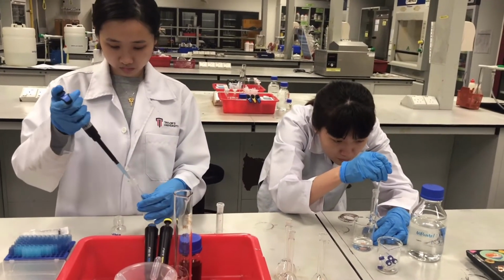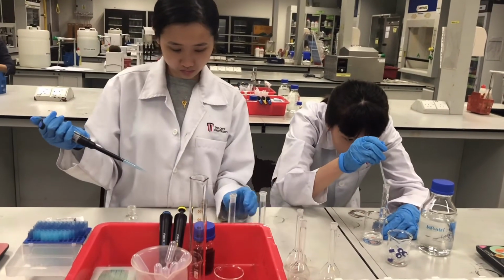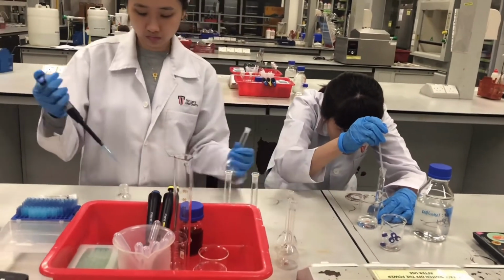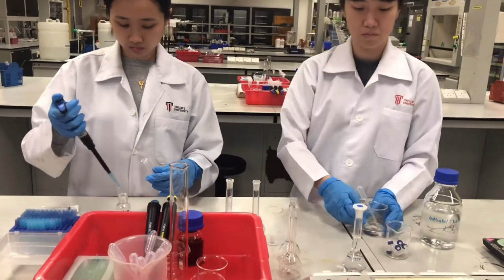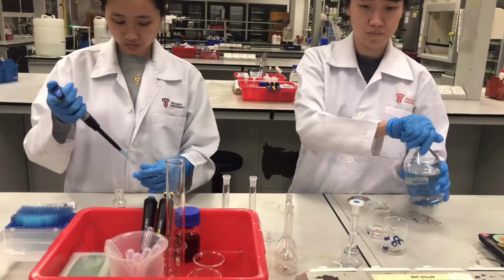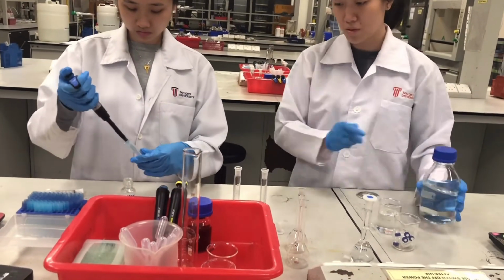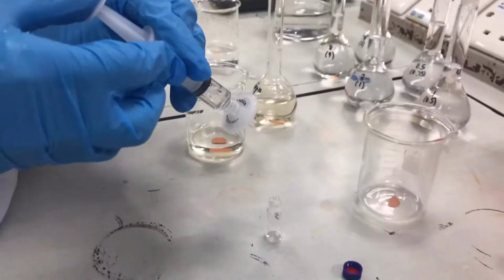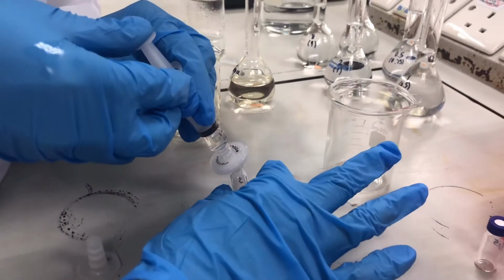And then 0.25 ml of caffeine stock solution is required to prepare 0.5 ppm of standard. And add the mobile phase up to 50 ml of the volumetric flask. Filter the solution to get rid of impurities.